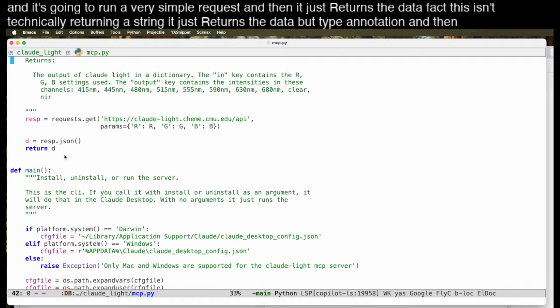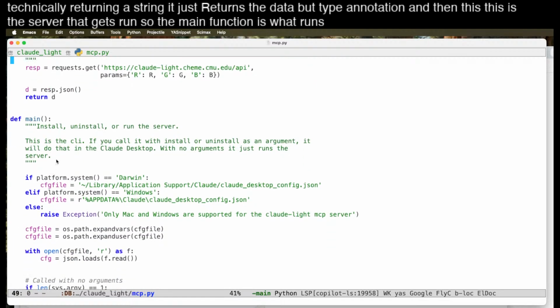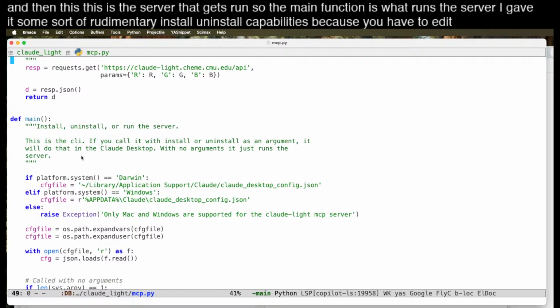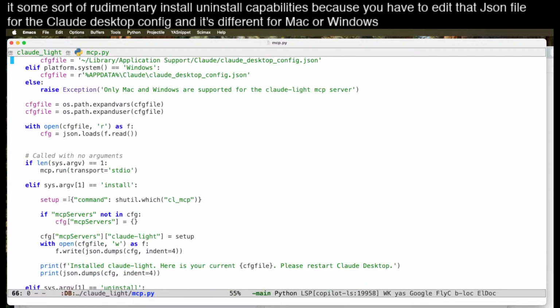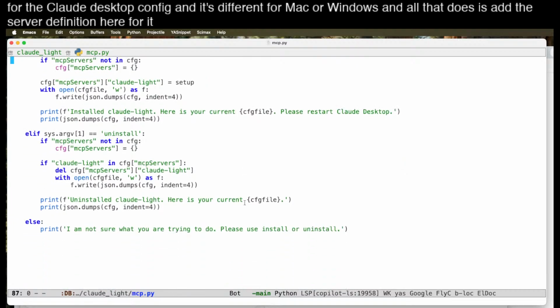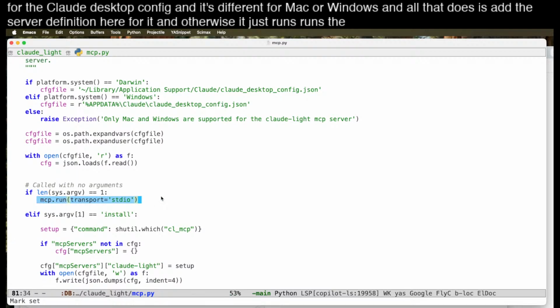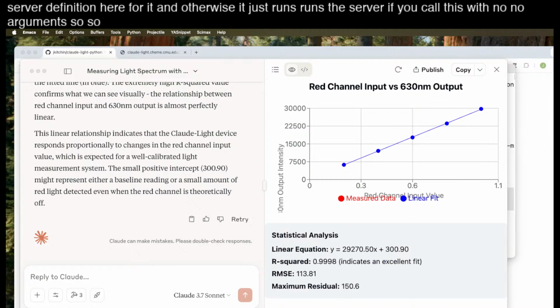And then this is the server that gets run, so the main function is what runs the server. I gave it some sort of rudimentary install, uninstall capabilities because you have to edit that JSON file for the Claude Desktop config, and it's different for Mac or Windows. And all it does is add the server definition here for it. And otherwise, it just runs the server if you call this with no arguments. So that's the main idea.